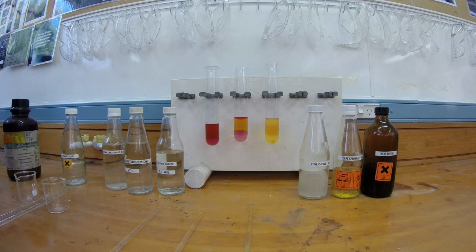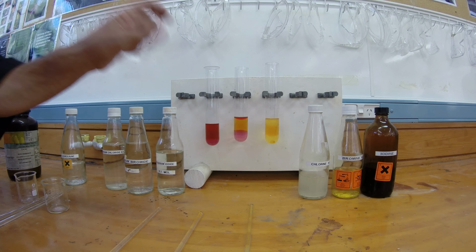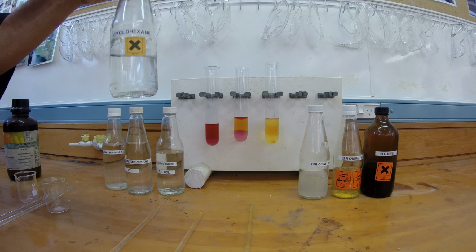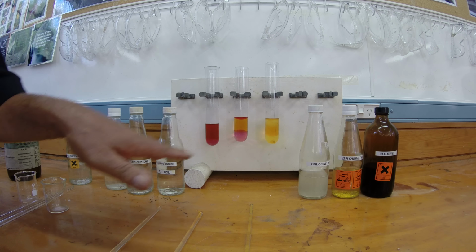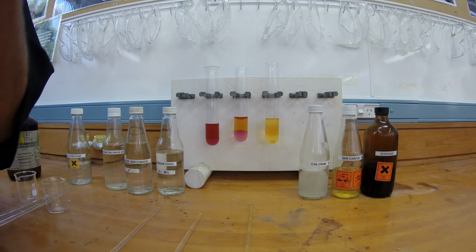So what we've got now is the bottom layer, which is one of the organic solvents. That one is more dense than water. Then we've got the middle layer, that's the water layer. Then we've got the top layer, that's the cyclohexane layer, because cyclohexane is less dense than water. So you end up with 3 layers. The layers don't mix because the top and bottom layers are non-polar, and the middle layer, water, is polar. So that's some reactions of halide ions with halogen molecules. The other combinations that you tried don't react, and we'll talk about why that is later.